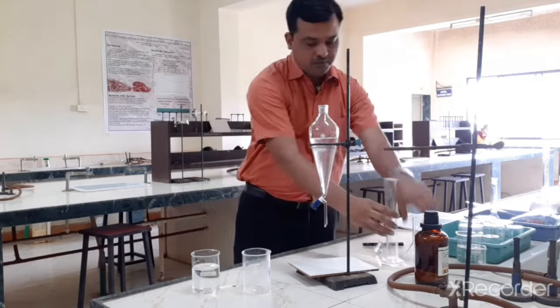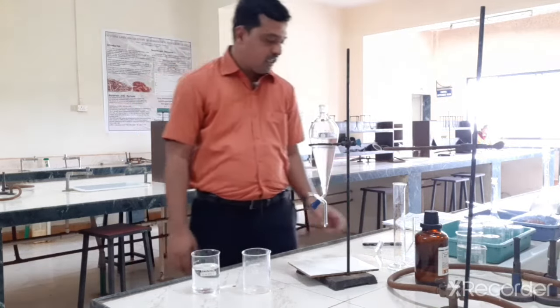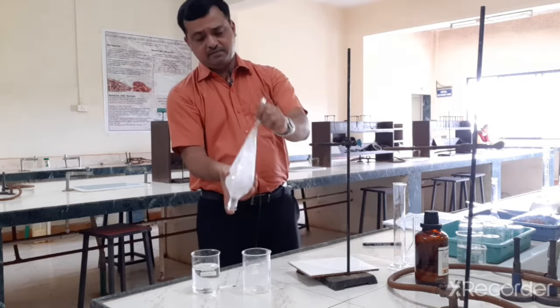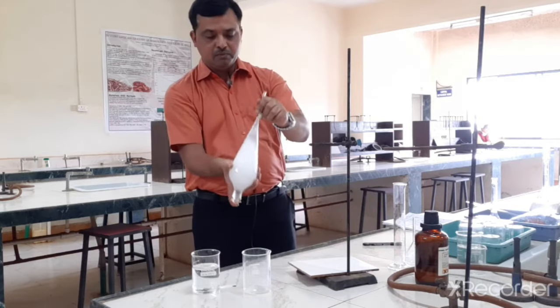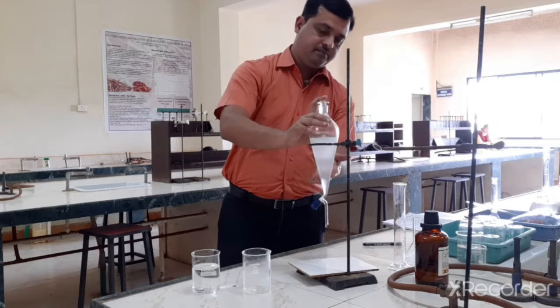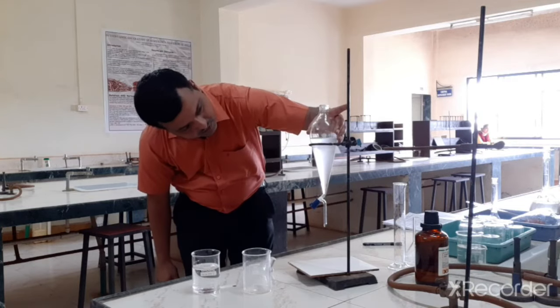So again we should remember the acetic acid, which is in aqueous form, is on the top, and the chloroform, though it is organic, because of the higher density is in the bottom. So we can do the extraction. Again you have to shake this. So what is happening, because of acidic pH, basic trimethoprim is getting ionized and it is shifting into an aqueous layer like this. So we have to allow it to settle down, so it will take some time.